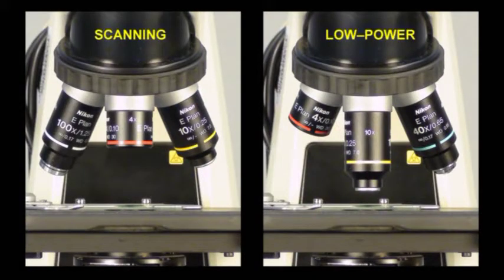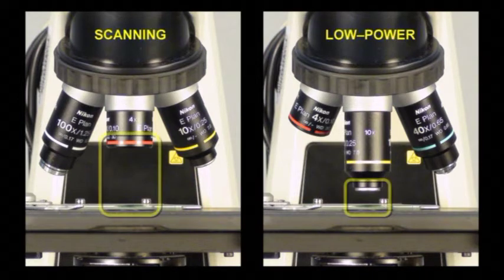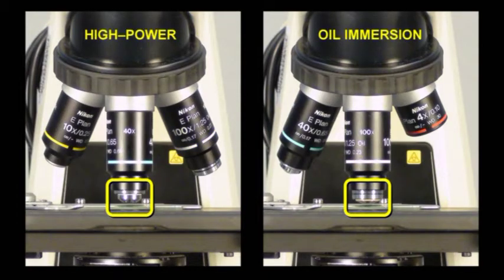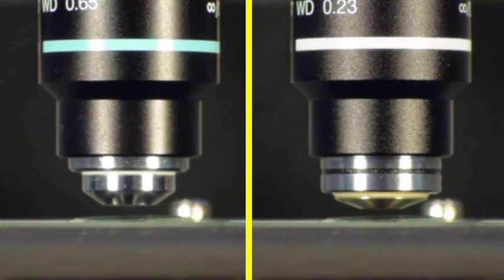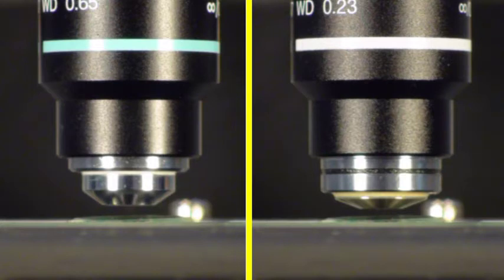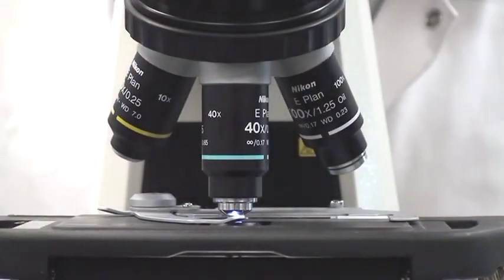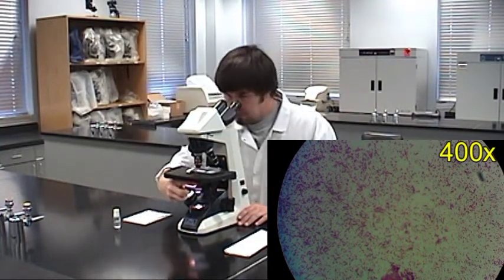When you adjust focus, use the coarse focus knob only when the scanning or low power objectives are in place. These two objectives are shorter and never come close to the slide, which prevents the slide from contacting the lenses during coarse focus adjustment. The high power and oil immersion objectives are longer and able to contact the slide. When either of these is in place, use the fine focus knob only. If you use the coarse focus knob, you risk striking the slide against the objective lens, which could damage both the slide and the lens. Also, adjust the iris diaphragm lever to maintain image brightness when you change magnification. You need more light at higher magnification and less light at lower magnification.